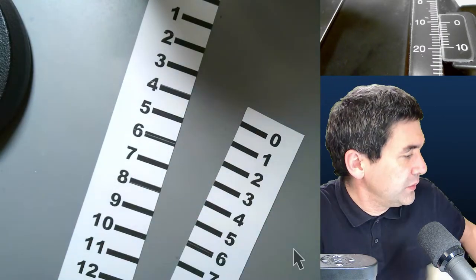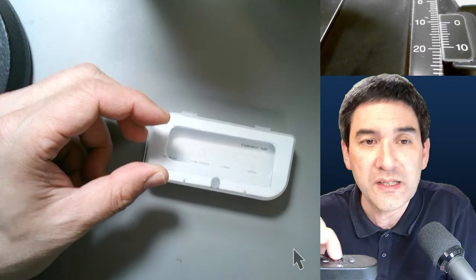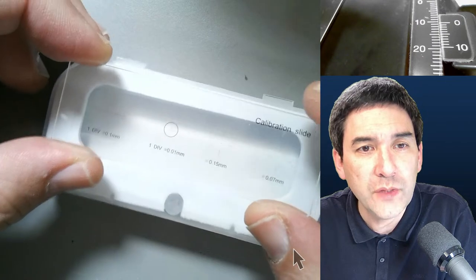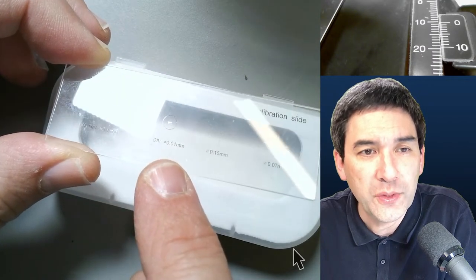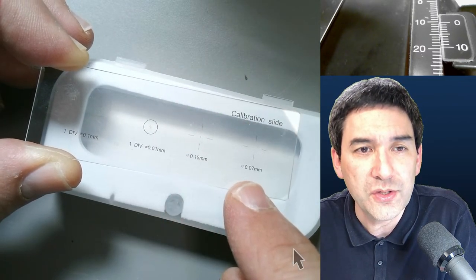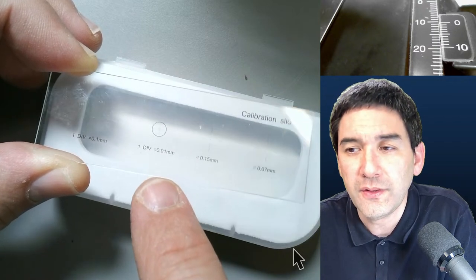I bought myself a calibration slide — let me make it a bit larger. I think I bought it on Amazon. Turning off the lights: one division is 0.1 millimeter, so that's 100 micrometers. The next one is 0.01 millimeter, which is 10 micrometers — approximately a little bit larger than a red blood cell. There's also a dot with a diameter of 0.15 millimeters and a dot of 0.07 millimeters. I most often use the 10-micrometer, 0.01 mm division.